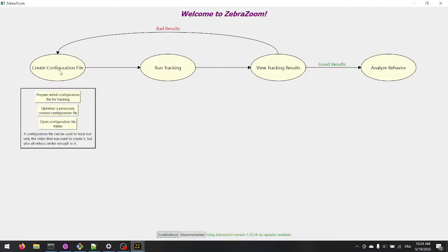This tutorial video will show how to create a configuration file for head embedded fish in order to run the tracking later on.